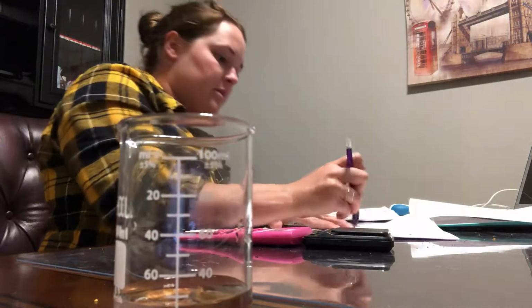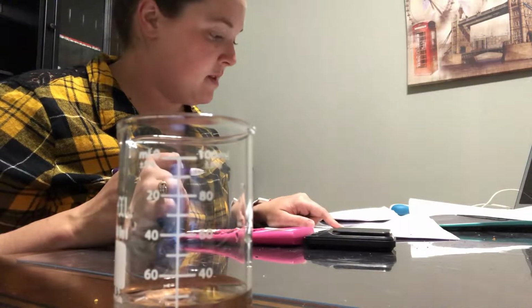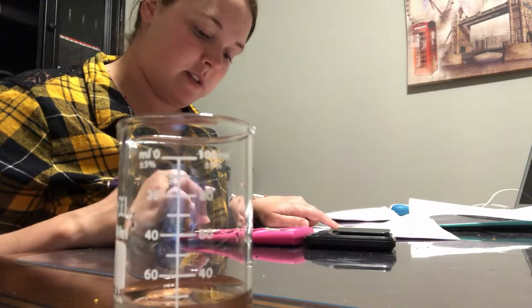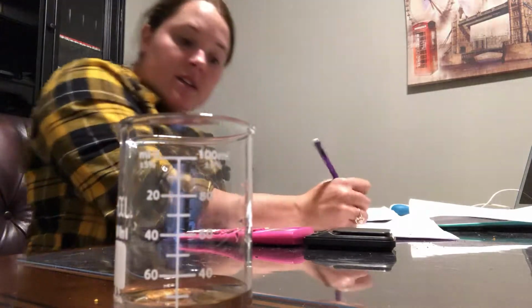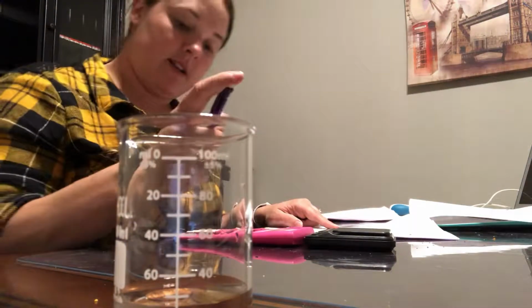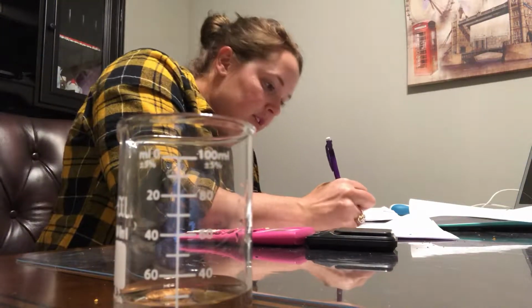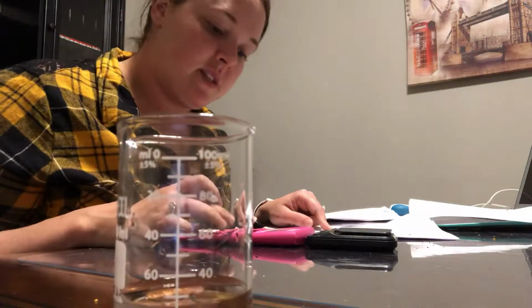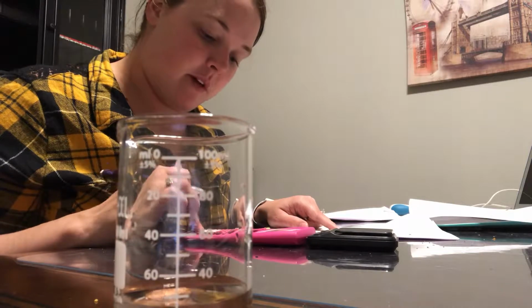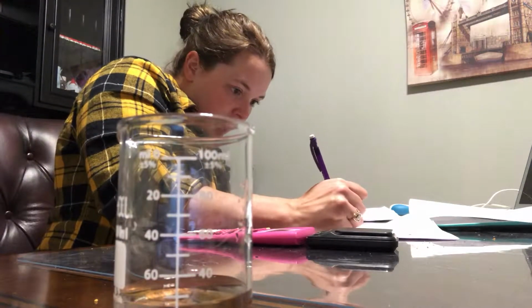And then the next one, 65.60 is going to be B5, plus 13.12, that's going to be C5. So it's going to be 78.72. And then it's going to go up another milliliter, so it'll be 30 mils. So it'll be 78.72 divided by 30. That's going to give us 2.62.